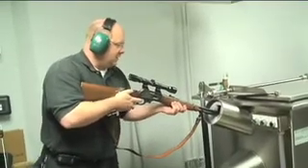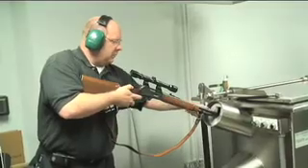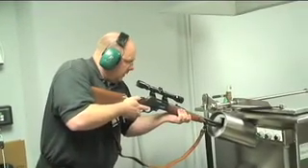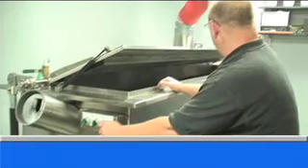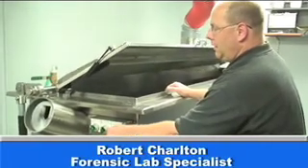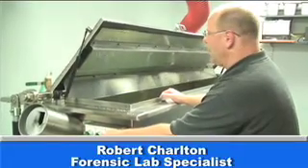We just have to make sure that it's about an inch, two inches past the little block right there. Okay, here we go. This is where we take all of our test shots in this tank, and the idea is to get a pristine test fire from your weapon.